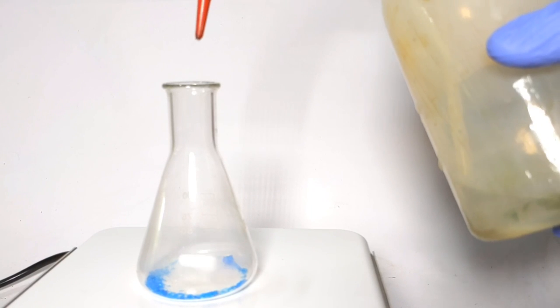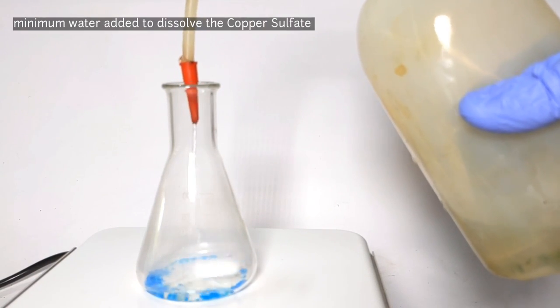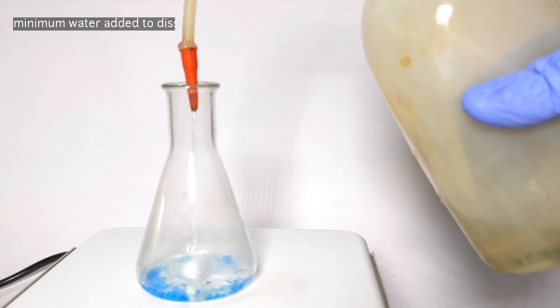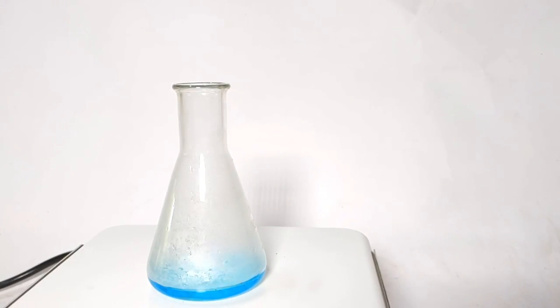Add minimum amount of distilled water to dissolve the compound. It might take some time to dissolve. If you are not patient, you can gently warm the solution to dissolve faster. Once everything is dissolved, you will be left with a clear blue solution.